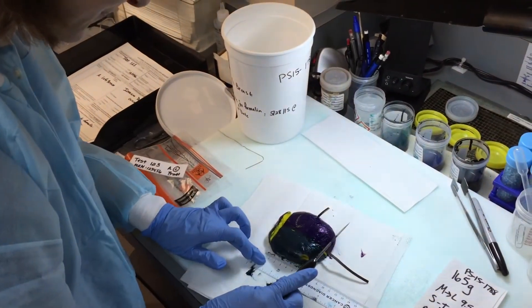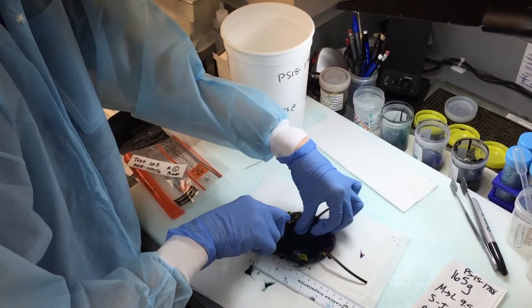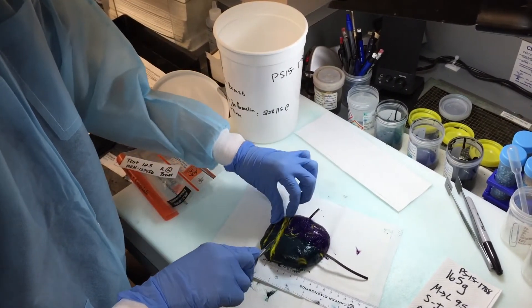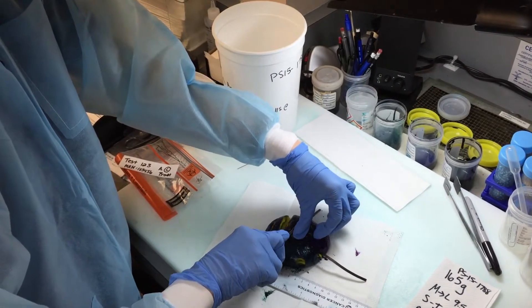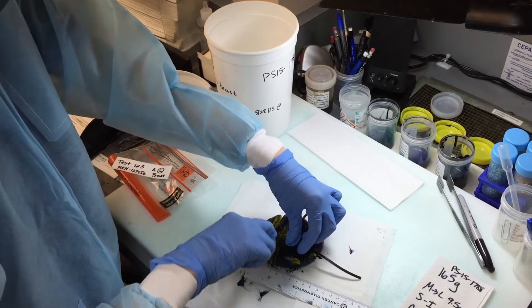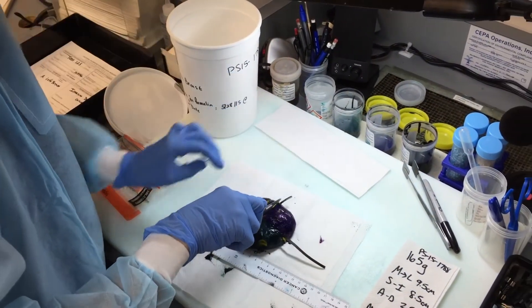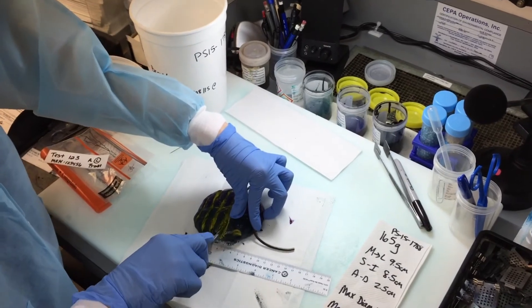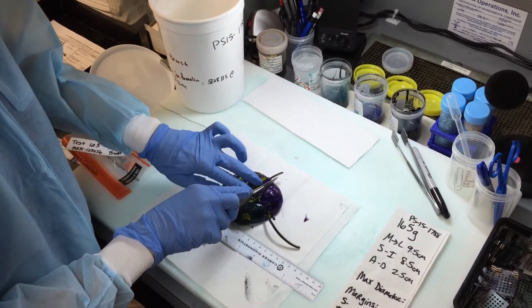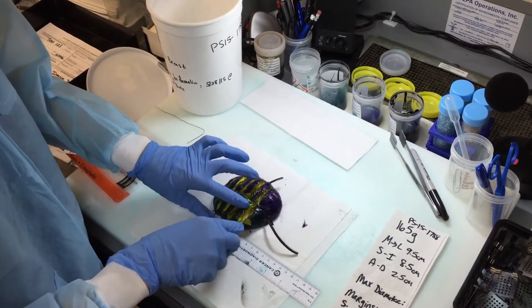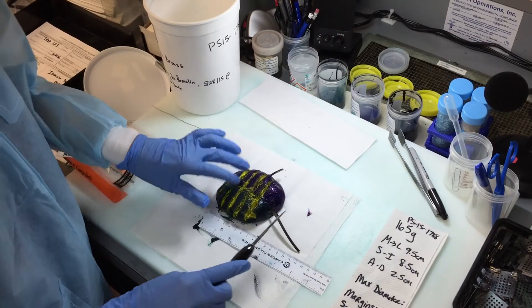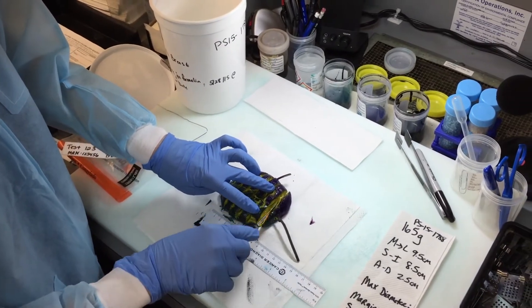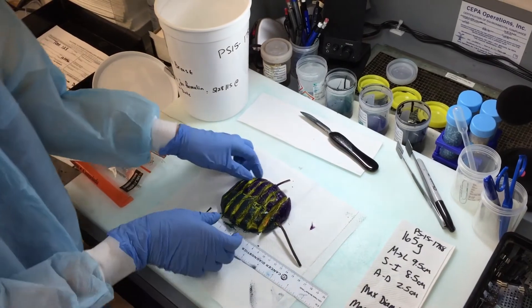And you want to cut all the way down to just leave a little tag of tissue at the deep aspect. Okay, and then just one more section towards the end there.